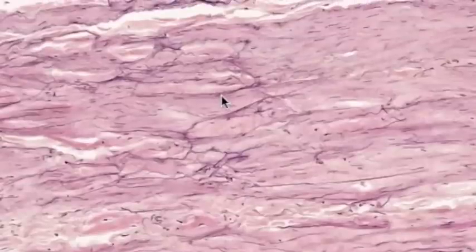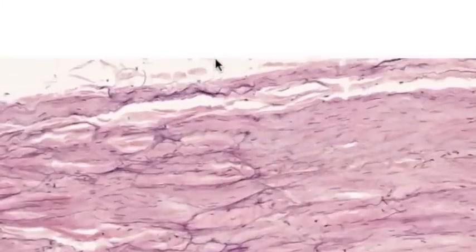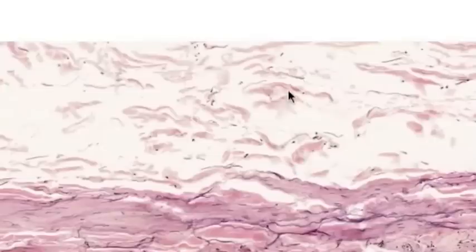The bulk of the screen is taken up with the tunica media, extending all the way out to where the tunica adventitia would be. Along this segment of the vessel, the tunica adventitia has been ripped off. If we slide down along the vessel a little bit further to somewhere where some of the adventitia is left, you can see that the adventitia is made of just some patchy connective tissue.